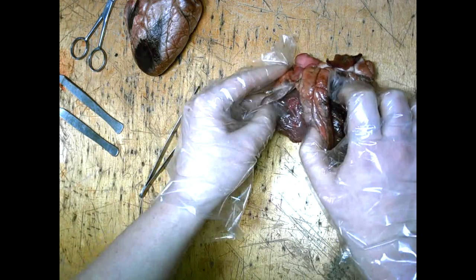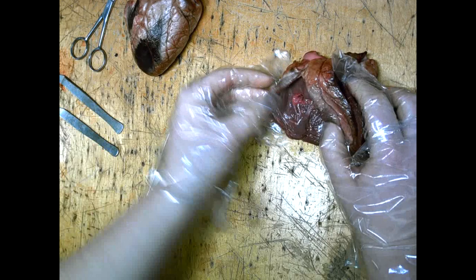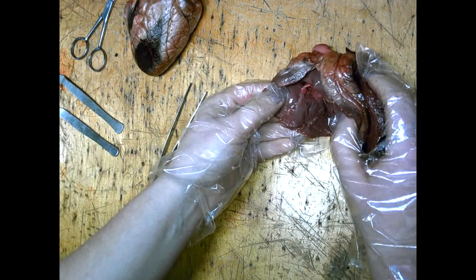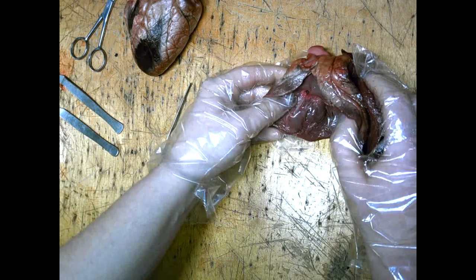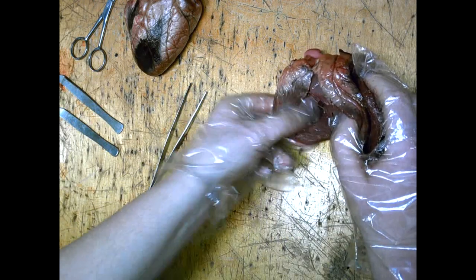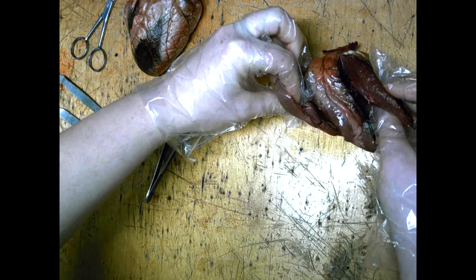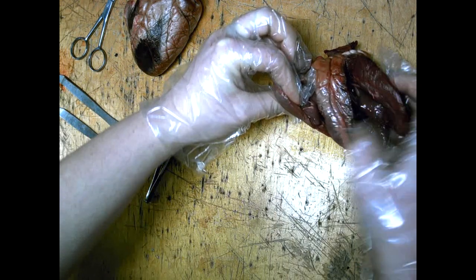The right side of the heart has much thinner walls. This is because the blood is only being pumped from this side up to the lungs, and so the heart doesn't have to work as hard on this side. As you can see clearly, there is a big difference in the thickness of the walls.